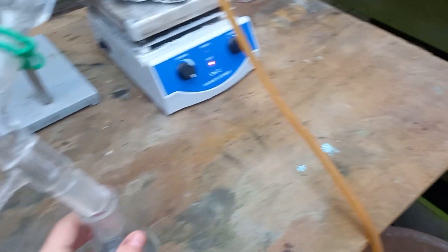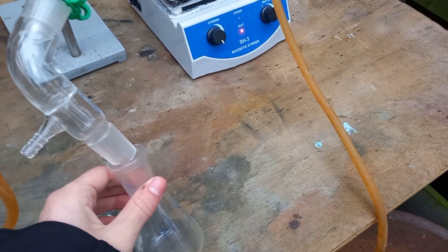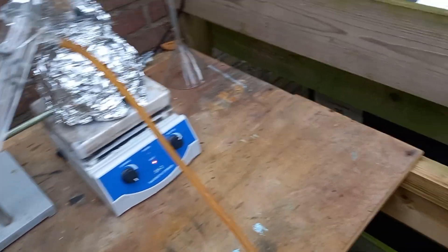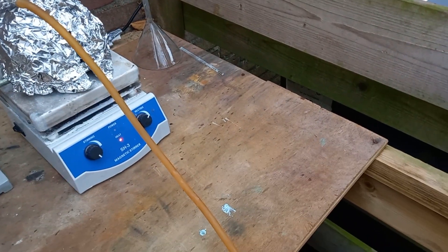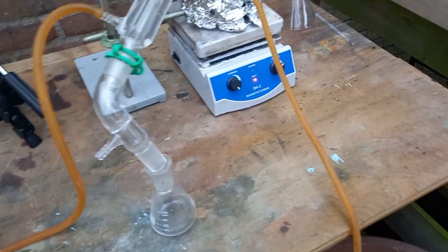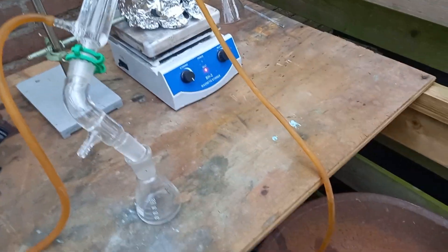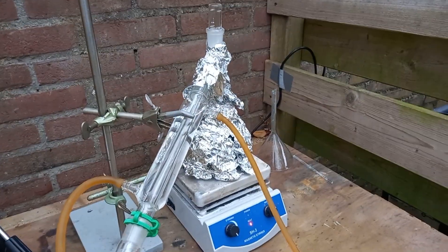Let's carefully smell if there's already some pyridine forming. It should be very diluted, so I'm not risking my health or anything. Oh god — yeah, that smells like rotten fish and gasoline. That smells so bad. Bad smell, but good sign!